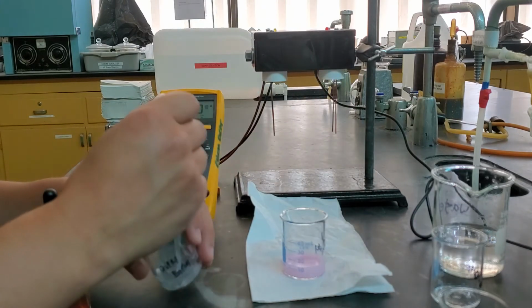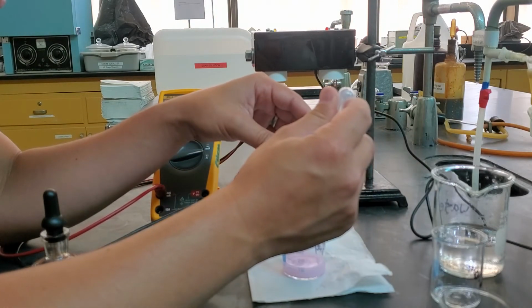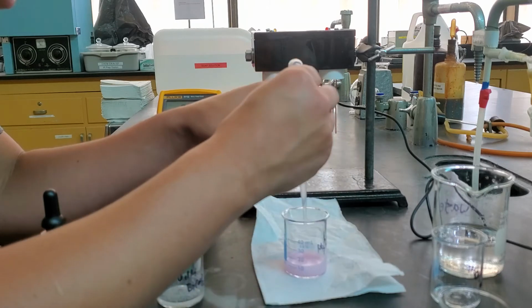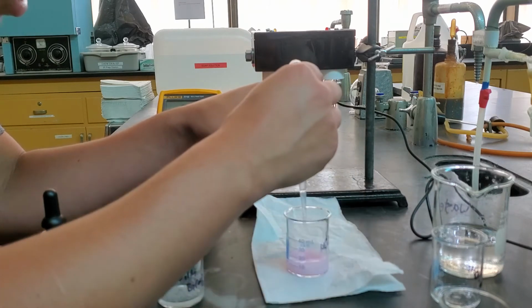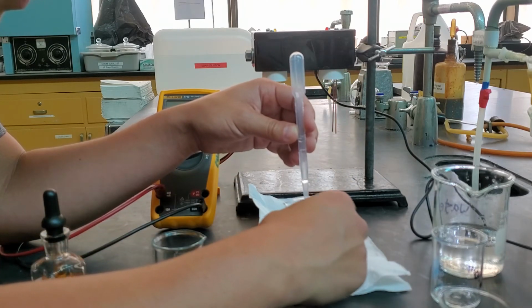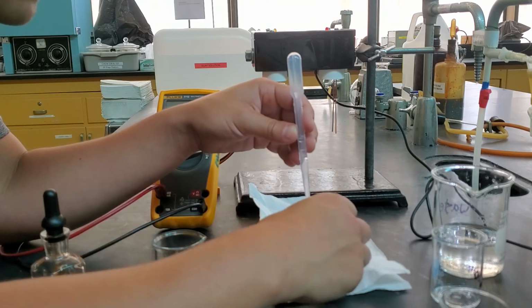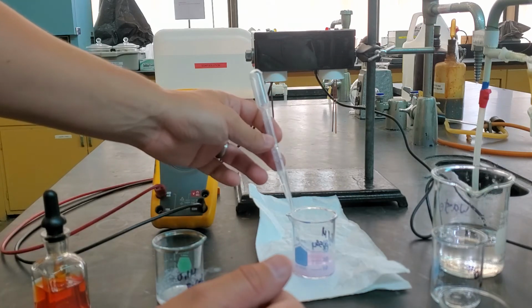All right. Now this is the beginning part of something we call a titration. A titration is where you take one unknown amount, which in this case is our sulfuric acid, and then we try to add in a specific amount of our known, in this case our barium hydroxide, until we get to a point where they're equal, which is what's going to happen when the color changes to that blue. We're still in that pink zone, but it is getting lighter. Still looking pink there.